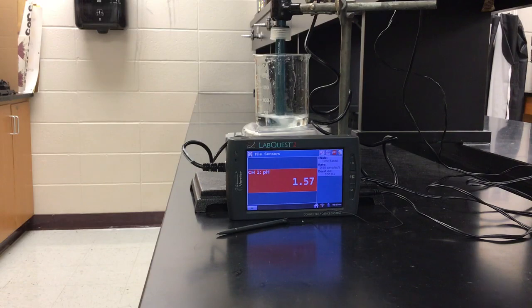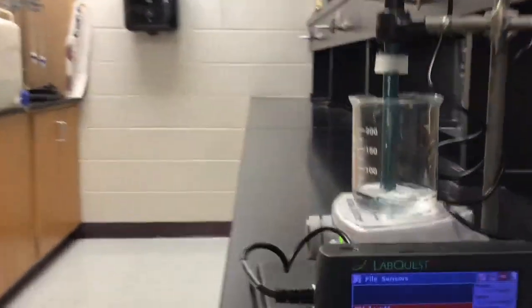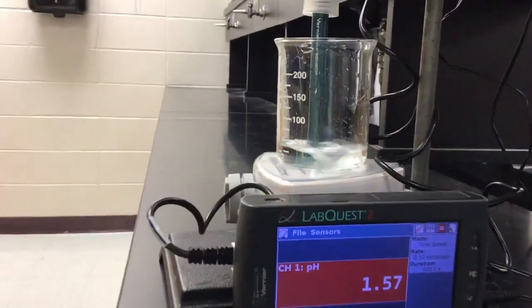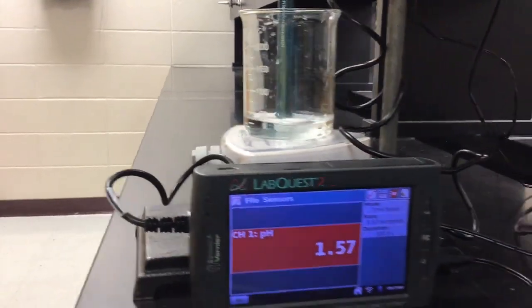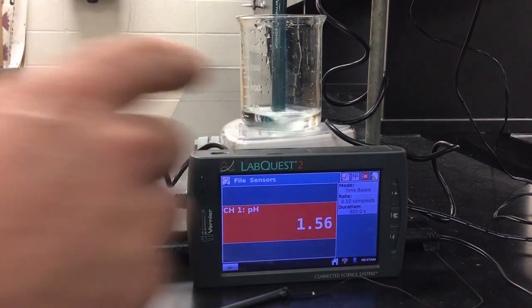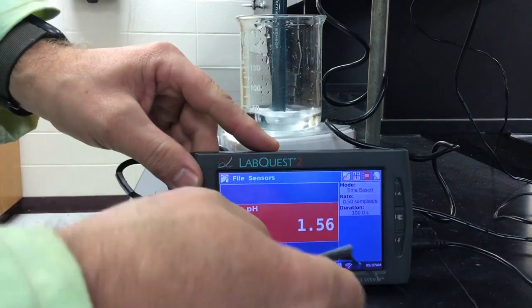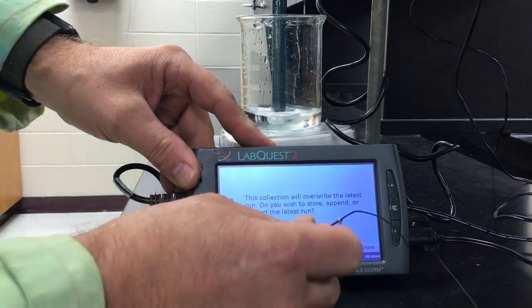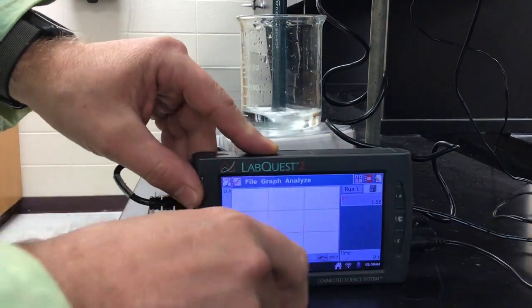Okay, so we're at the beginning of the lab now. I'm going to move you a little bit closer so you can see what's going on here. A little bit too close. Let's see. That's pretty good right there. All right. So here's our starting point. What I'm going to do is go ahead and graph it. It's not going to be a perfect smooth graph like I showed you before, but it'll be okay.